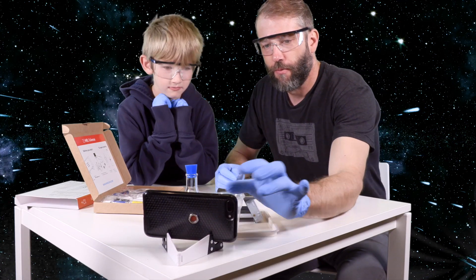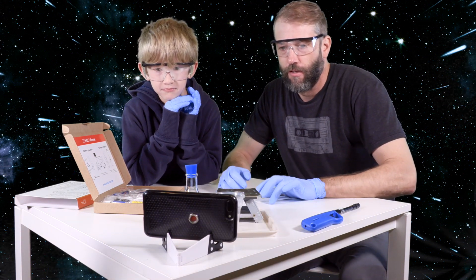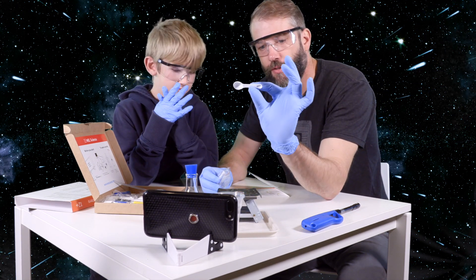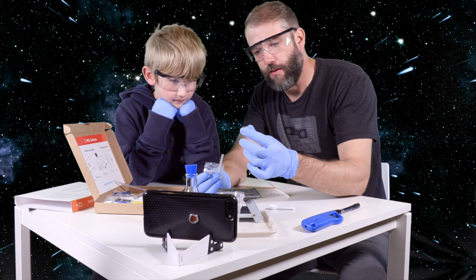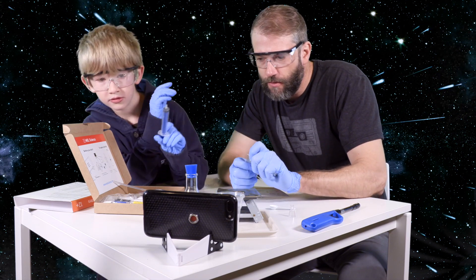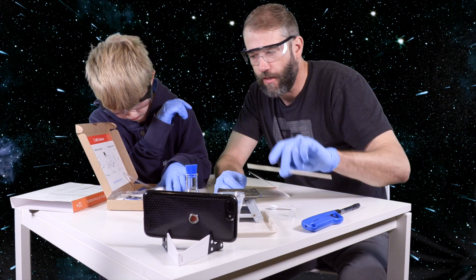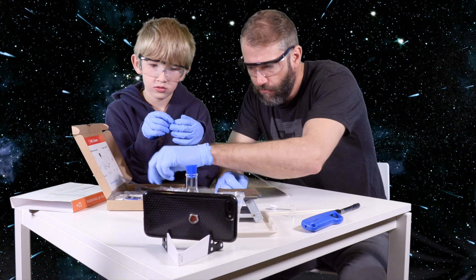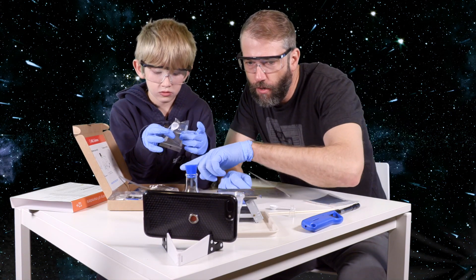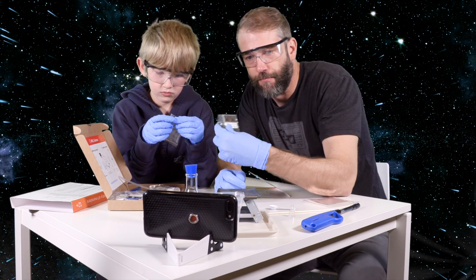Let's get these gloves on. We're going to click start experiment. Prepare in advance: matches. We're going to take one of these double-sided measuring spoons and this little plastic funnel. We've got our gloves and we're going to need one wooden stick. We need the thermochromic sticker — that's what this is. This is a thermochromic sticker.